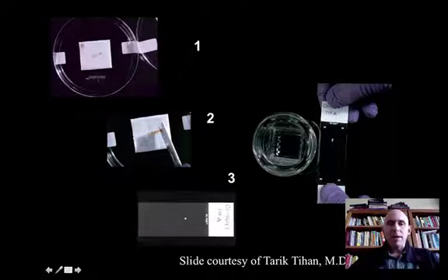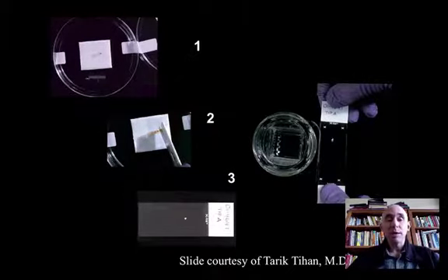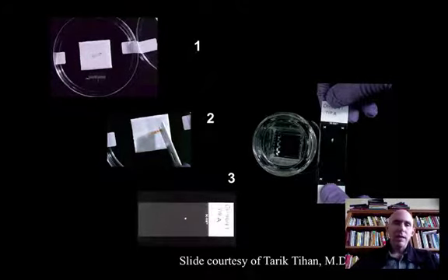You may ask, am I asking you to do this in a sterile fashion? No, usually not. Usually it's not necessary to study these sterilely. Of course, if there's a clinical suspicion of infection, or if material is going to be handed off that might be cultured eventually, you'll want to handle it sterilely, but ordinarily that's not necessary.